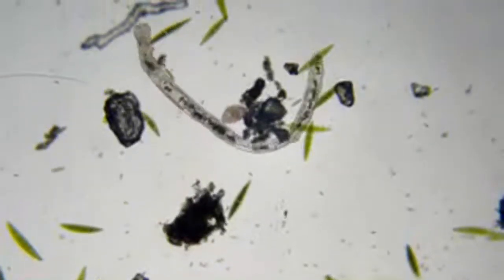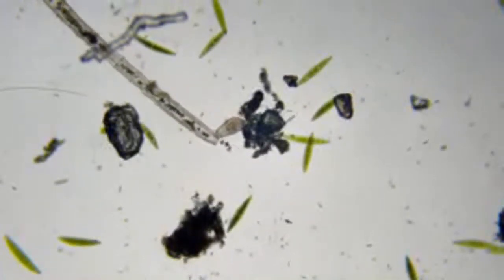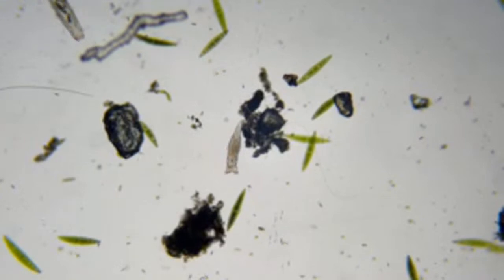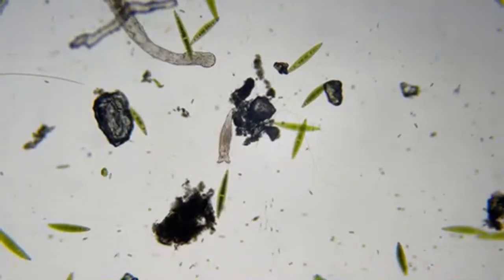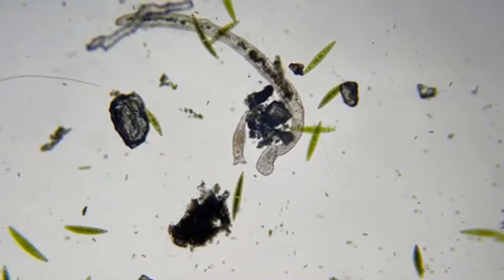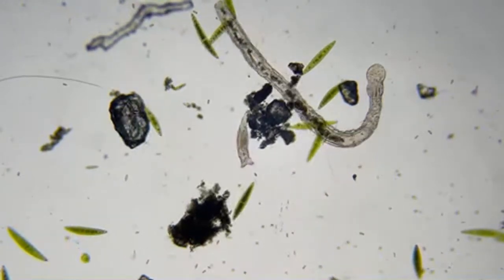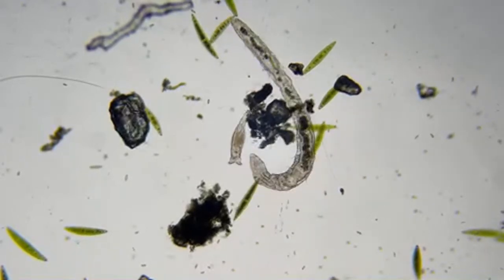And that's a nice rotifer right there. Yeah, so the small movements, like y'all said, I'm just answering that question again, comes from a 3D stage. If you can't afford it, my recommendation would be to save up for it, and you'll love it in the long run, even if you have to save for another 6 months.